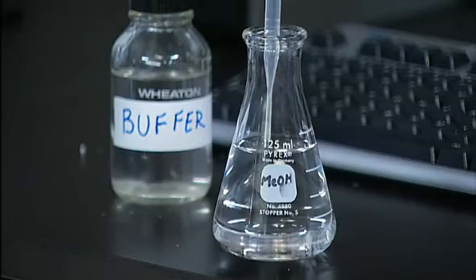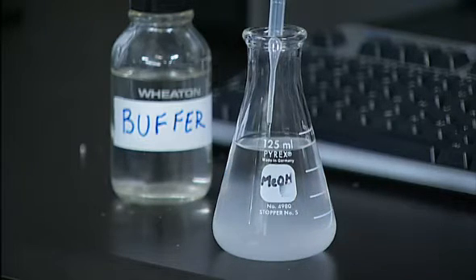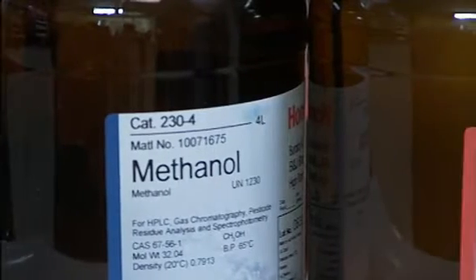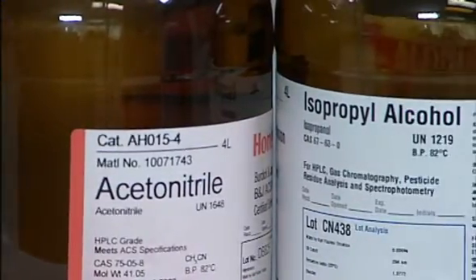Many of us are using reverse phase chromatography, where the A solvent is usually a buffer salt in water, and the B solvent is a water-miscible organic solvent such as methanol or acetonitrile. When we start to do the backflushing experiment, we want to make sure we don't add organic solvent directly to the buffer system, because if we do that, there's a good chance that the buffer may precipitate out of the column, and that's going to cause even further back pressure problems. So the first thing you do is to wash your column with the mobile phase you're using for your method, but without the buffer salts present.